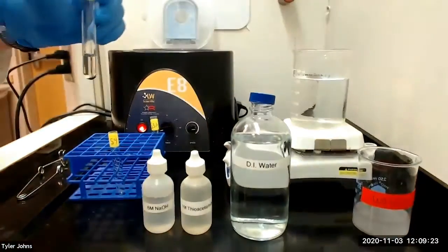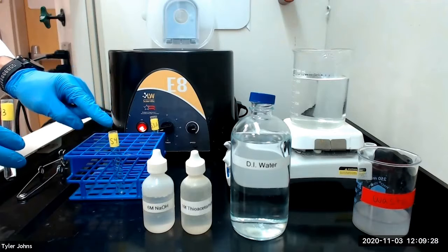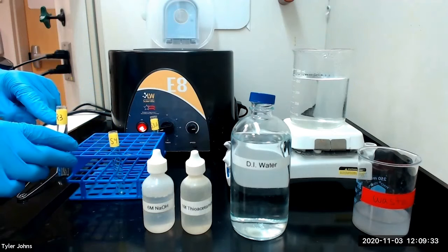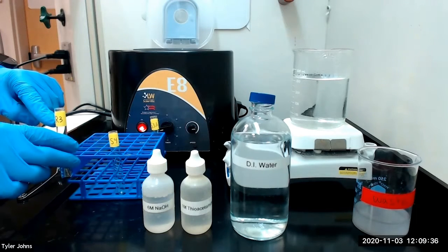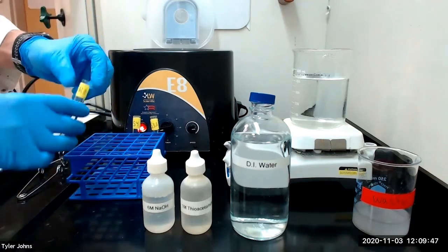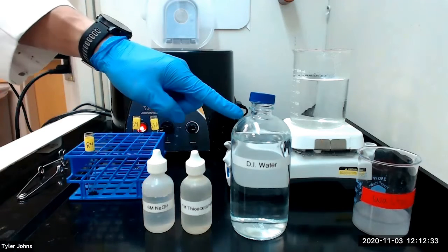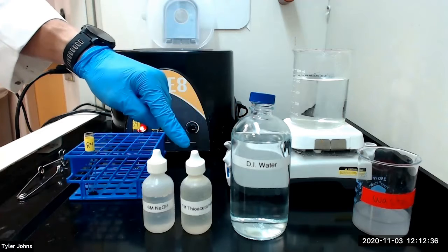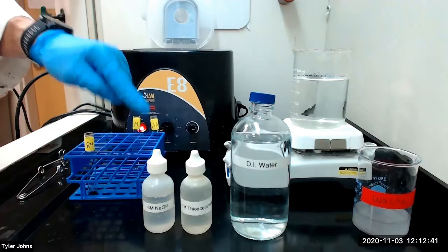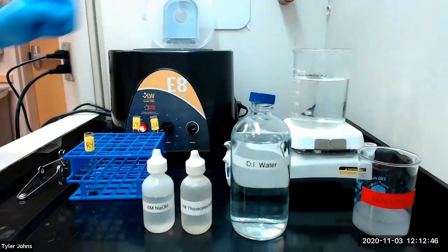We will next decant the solution into a new test tube labeled S4 and save test tube S4 for later analysis. We will then relabel the residue R4 for residue R4. We will next wash residue R4 with 3 milliliters of deionized water, 1 drop of 1 molar thioacetamide, and 1 drop of 6 molar sodium hydroxide. We will stir the mixture well, centrifuge, and discard the wash liquid.